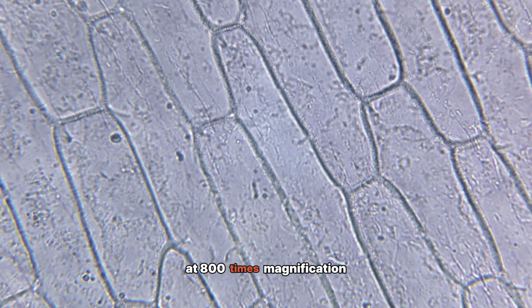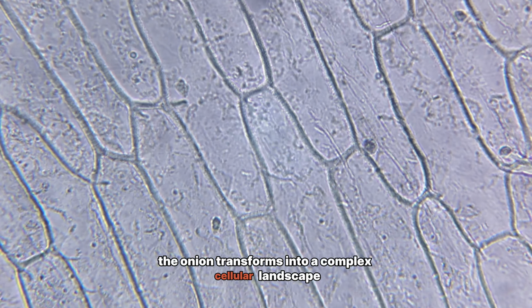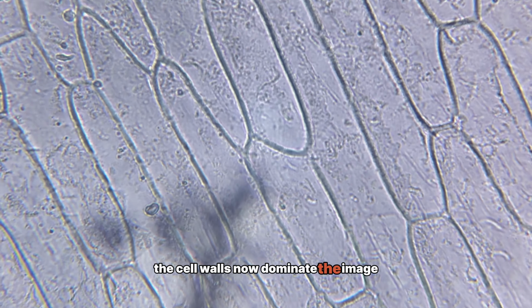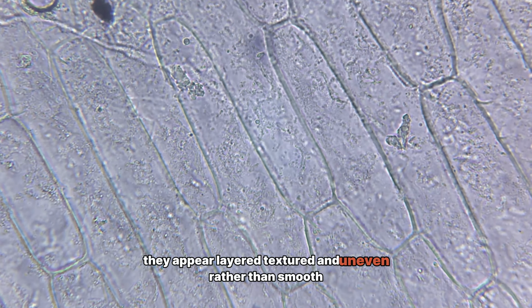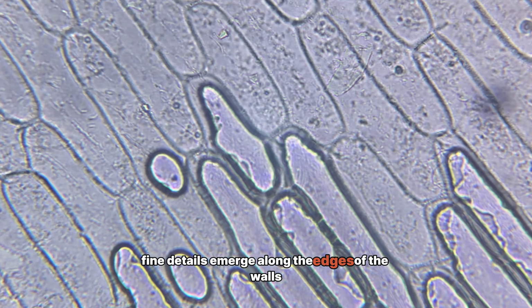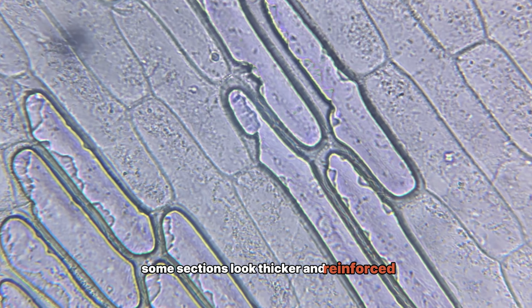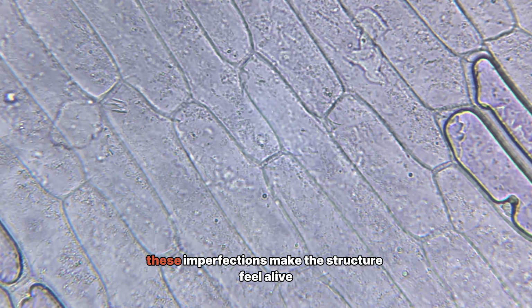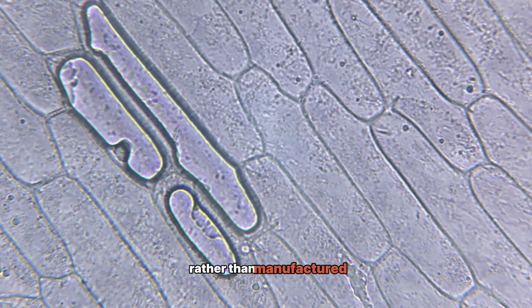At 800 times magnification, the onion transforms into a complex cellular landscape. The cell walls now dominate the image. They appear layered, textured, and uneven rather than smooth. Fine details emerge along the edges of the walls. Some sections look thicker and reinforced. Others appear thinner and slightly irregular. These imperfections make the structure feel alive rather than manufactured.